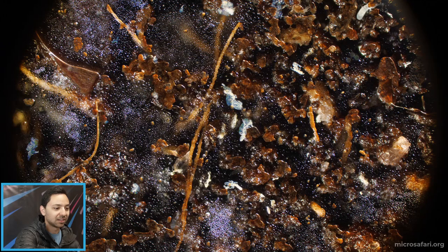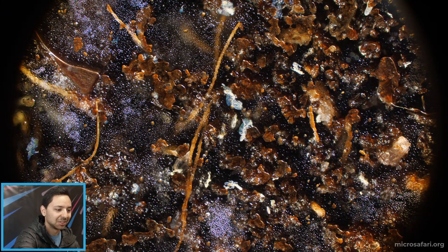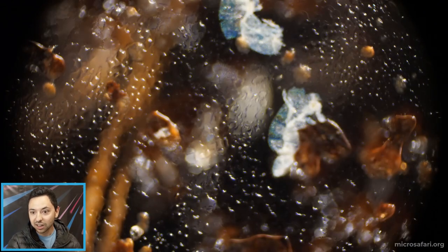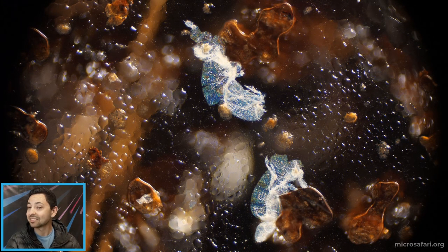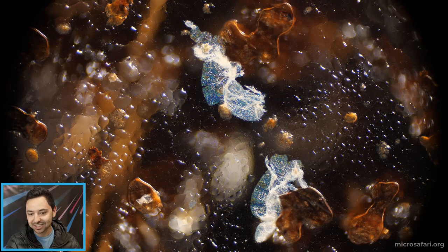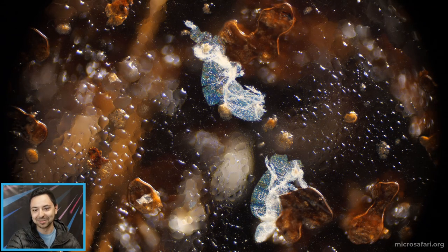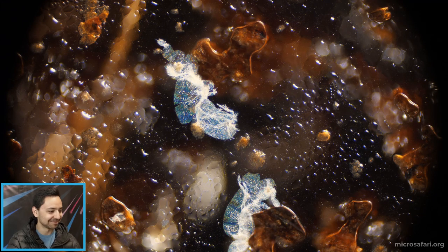We're going to — there's so much to explore, so many ecosystems even within this one ecosystem. We've gotten through maybe one one-hundredth of the total interesting stuff you could find in here. Check these little things out — if you just came across these randomly you'd be like, what is this? I have insider knowledge: these are shed skins of springtails. They molt just like insects, and for whatever reason their molted skins take on this beautiful opalescent color. I don't know if it's just an iridescent phenomenon or what, but so pretty.